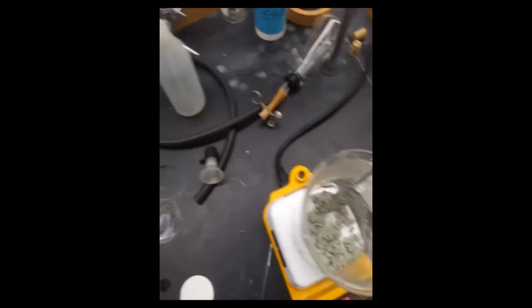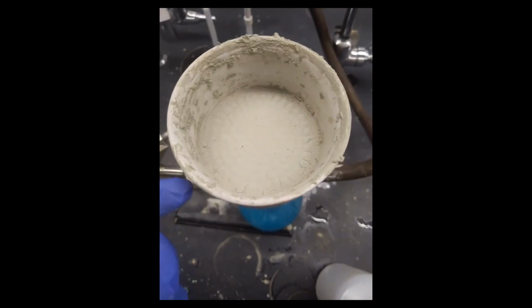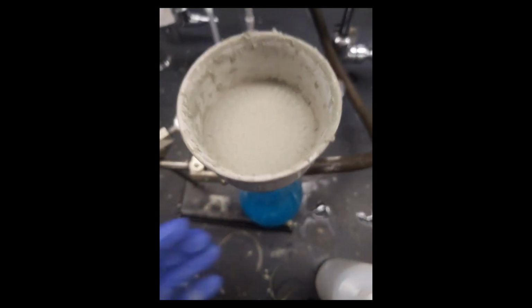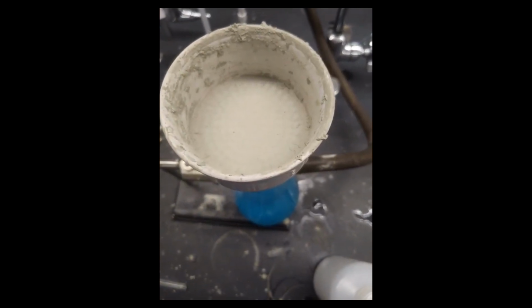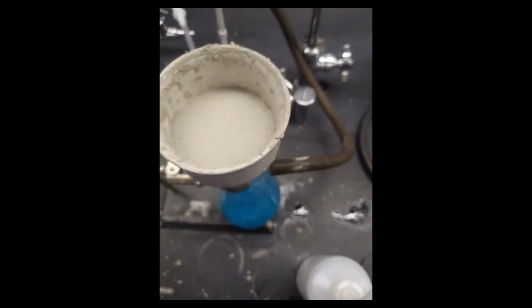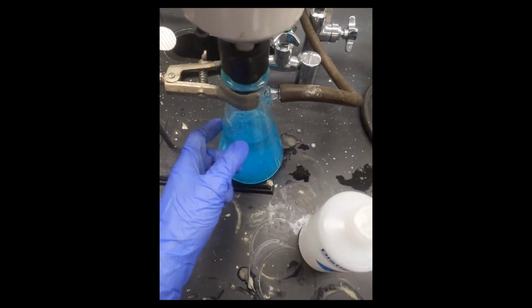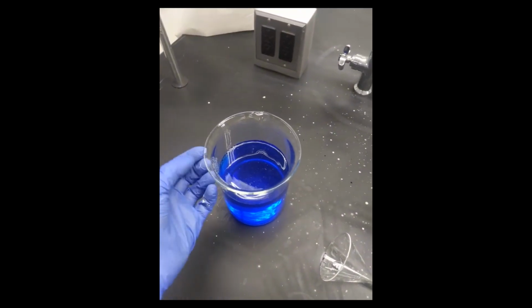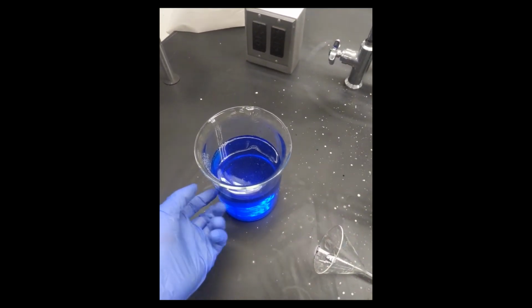It's a significant amount. And then tier three, I'm just gonna put this in a little vial. I'm not gonna use it. It's contaminated by copper. This is after I've been washing everything, and then I washed it all, and then I shook it, it's tier three, okay? This is pretty low concentration. I still dispose of it safely. And then I've got a lot of copper nitrate and probably some silver nitrate in here.